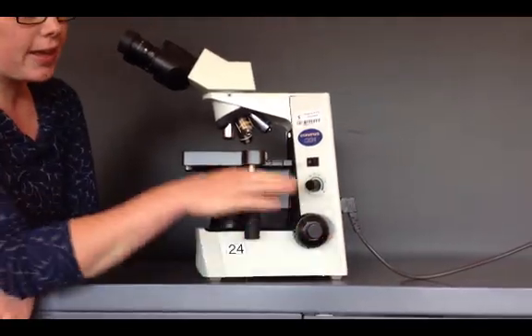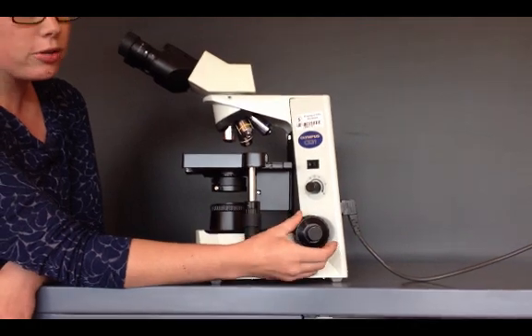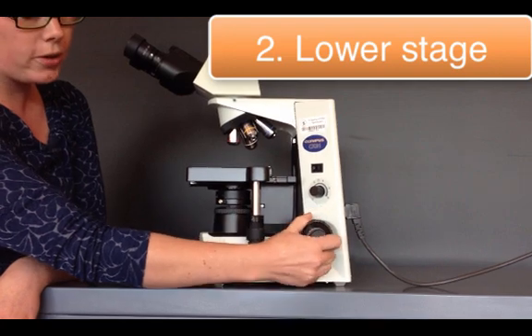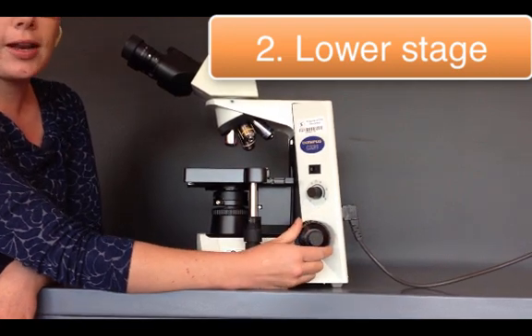You want to make sure that the stage is all the way down. You're going to use the coarse adjust to lower the stage down gently. Do not force the stage down any further than it allows.